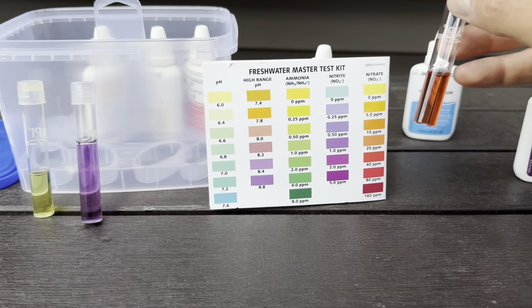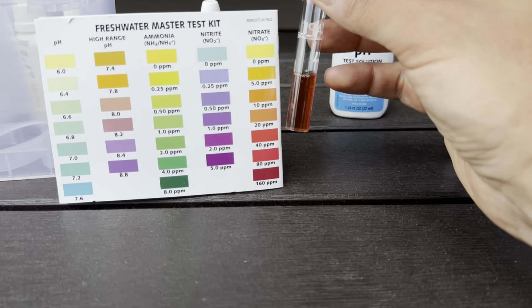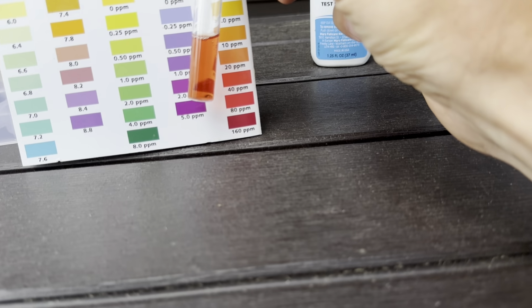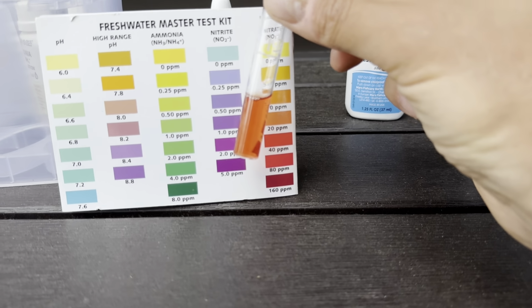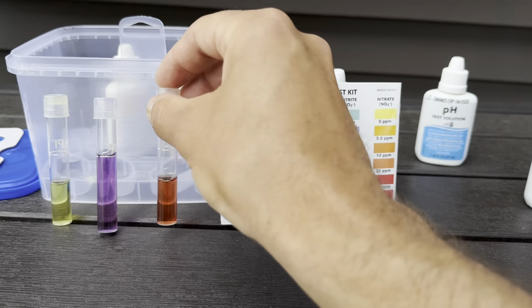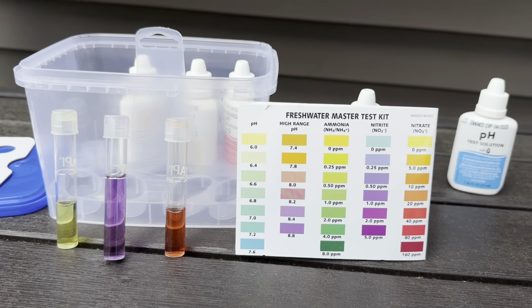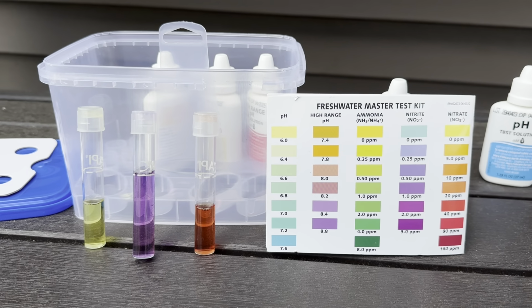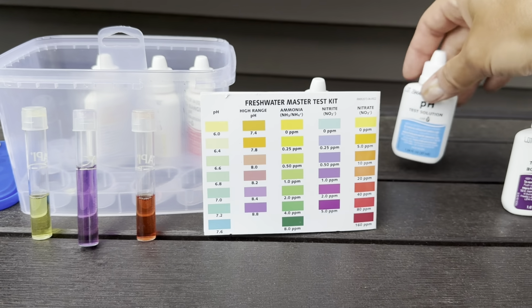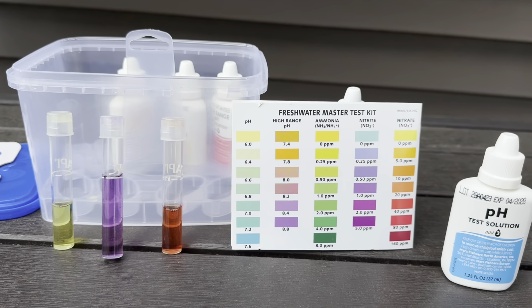And here's the nitrate. So nitrate is somewhere in there in 10, 20 parts per million. It's hard to tell. Maybe 30-ish. So that wouldn't be the worst thing ever, but that's telling me the pond's not cycled, and it's been running since April 1st. So it's been 2.5 months. It's not quite cycled. So that is not ideal. So that is what I'm up against right now. I'll check the pH, but it doesn't really matter because none of the rest is cycled.